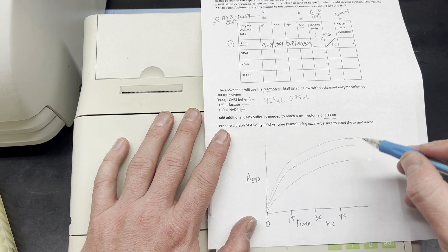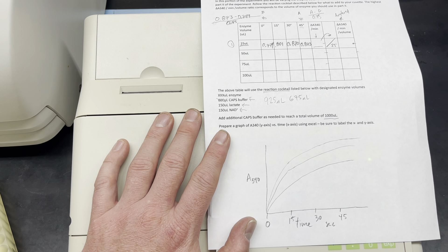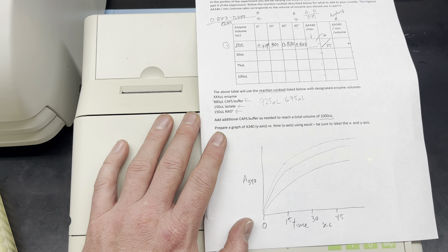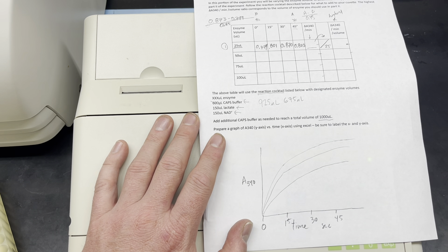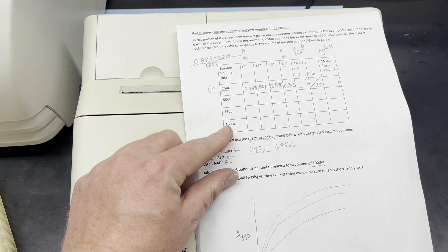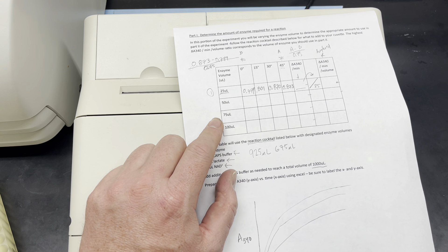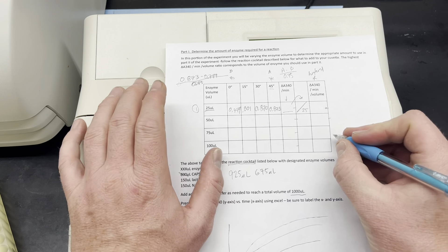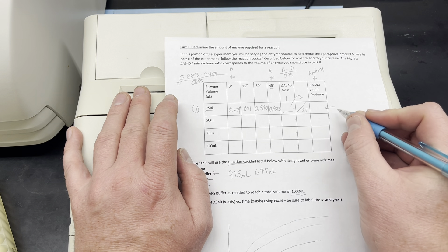I'm going to add 150 microliters of sodium lactate, mix it up a little bit by pipetting, then put it back. Now I'll get a fresh pipette tip and add 150 microliters of my NAD+. So right now I've got 675 microliters of CAPS buffer, 150 of sodium lactate, and 150 of NAD+.